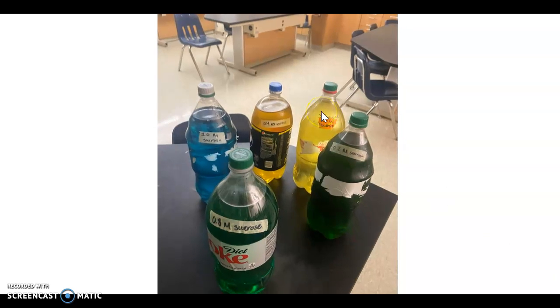All right, so this is a video to serve as a makeup video for those of you who might miss the lab. So I'm just going to go through what we did in the lab so that way you can fill out the lab handout and have that as a resource for the quiz. So this was our Osmosis Lab.